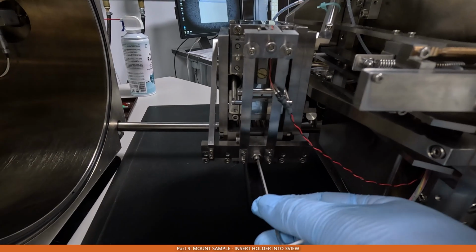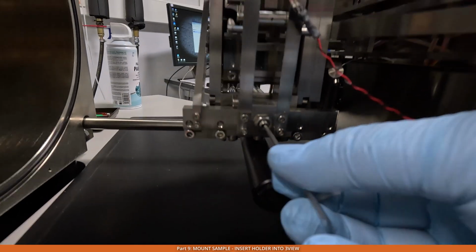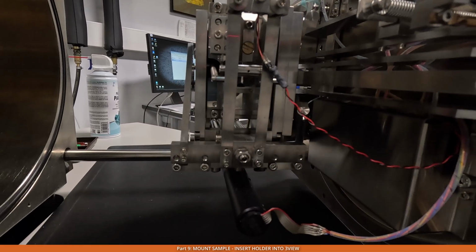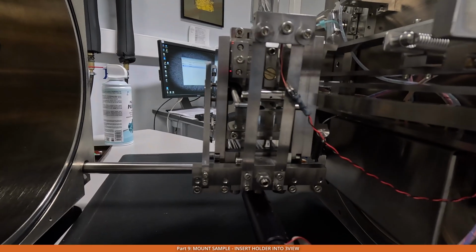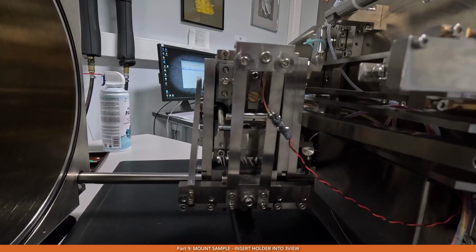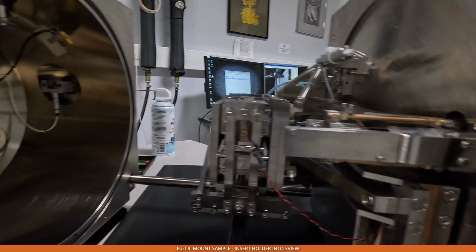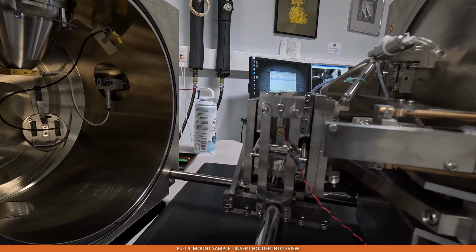Also, there is one more screw here, which is at the bottom. Hopefully you can see this. This screw changes the position of the knife forward to us or backwards from us, and it can be used to tweak the area the knife will cut. To fix this, we need to undo this screw, the big nut here.